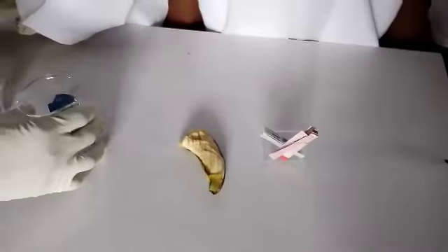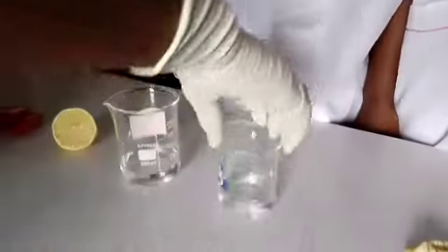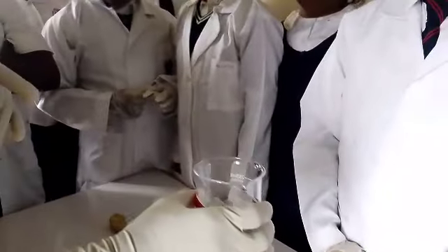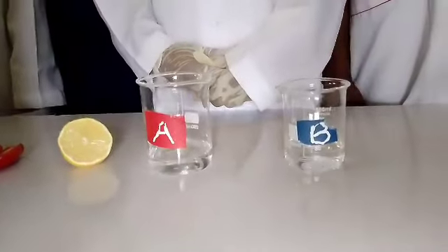We have a substance here. This substance is a base. Okay? So that's a base. While this substance is an acid. This particular substance is called hydrochloric acid. Now, hydrochloric acid can be formed in the stomach and it can be artificially made. So this is the artificial acid. Okay, so let's go ahead and do the test.